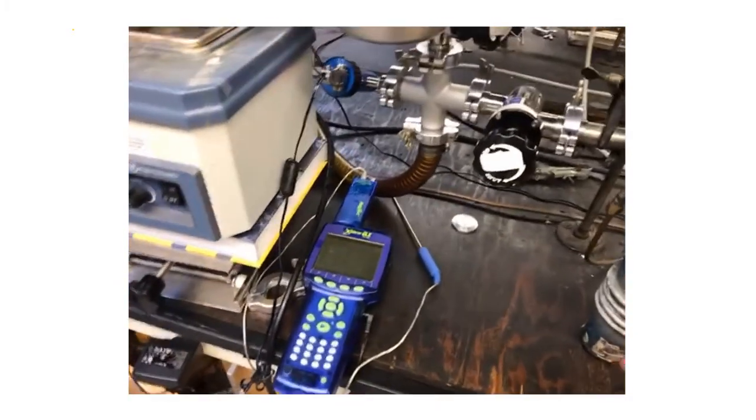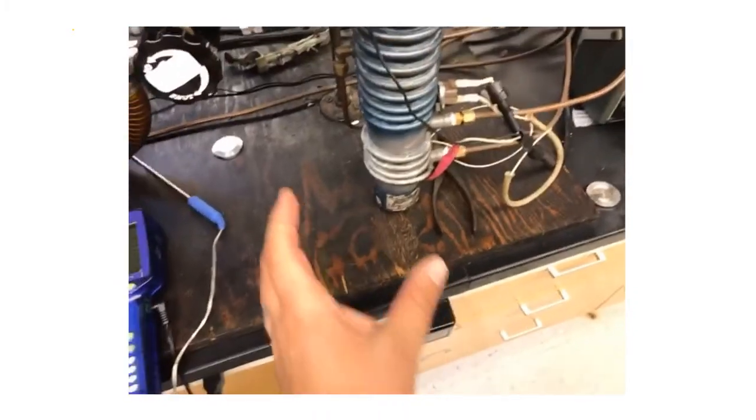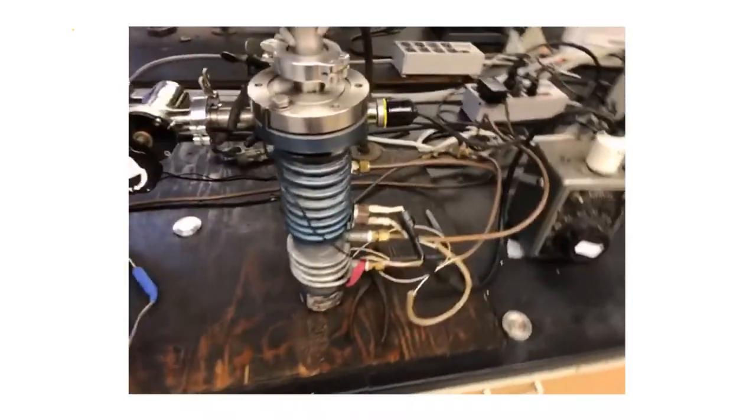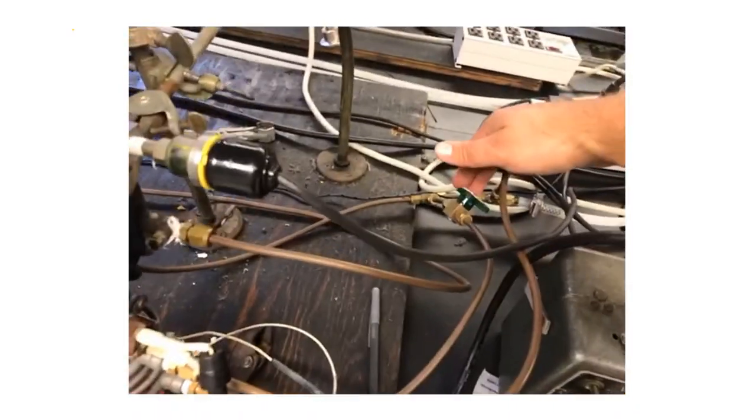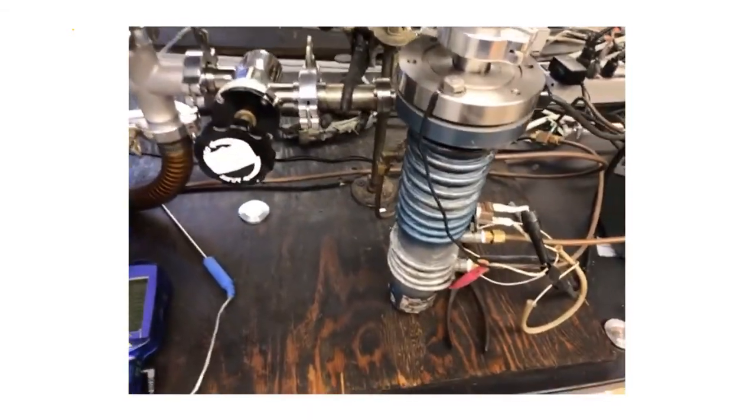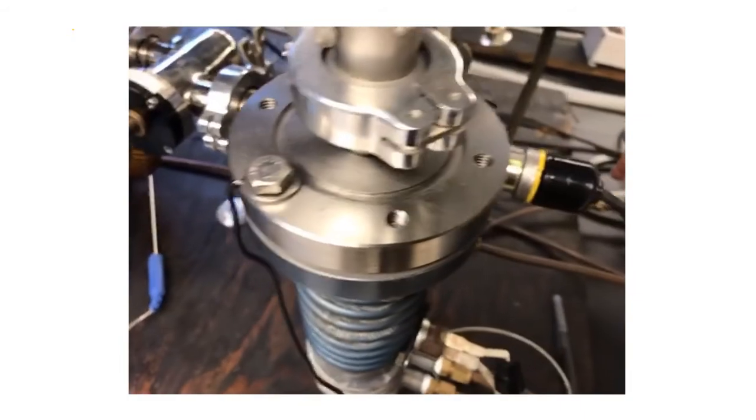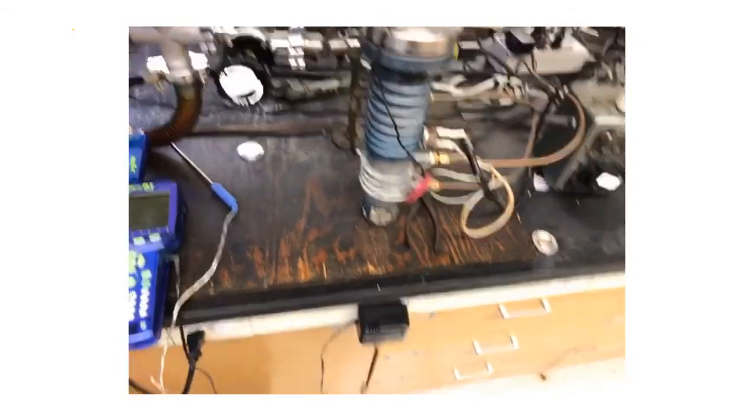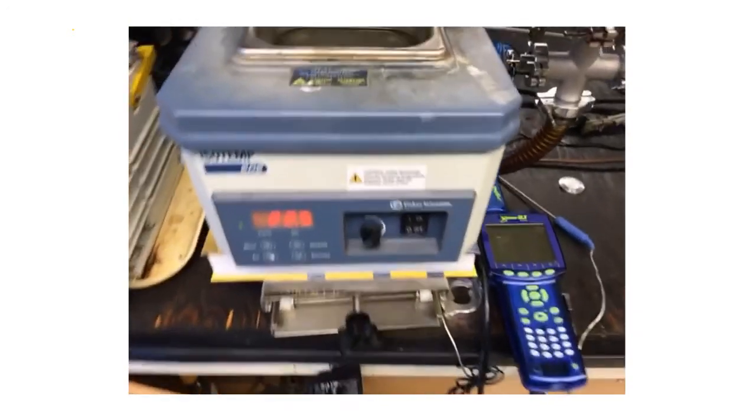The diffusion pump is actually hot, so definitely don't touch it—this will burn your hand. Don't touch the lower coils. This here is an emergency cooling valve. It's not the biggest ordeal in the world if we were to lose power, but if we lose power, we just open the lower condenser coils. Water will flow through the diffusion pump and cool it down.